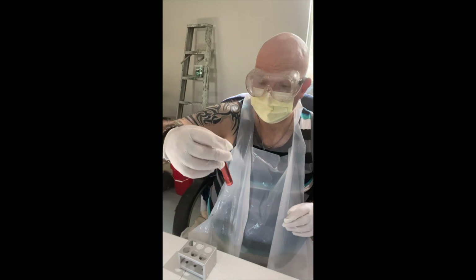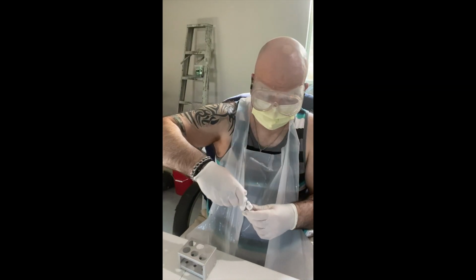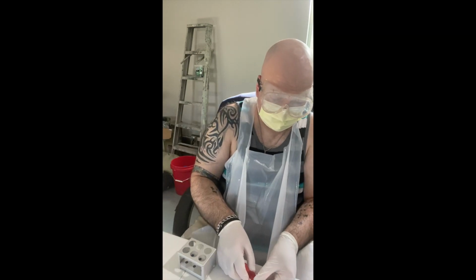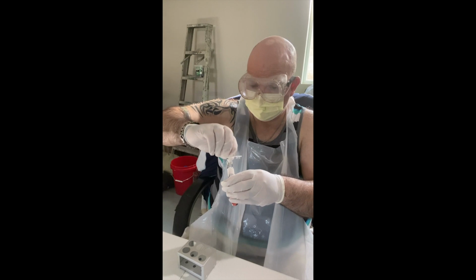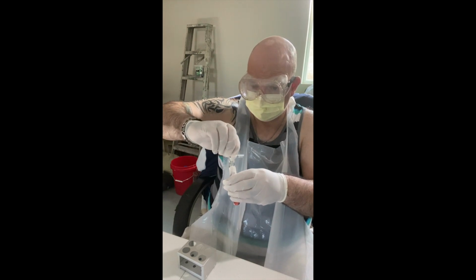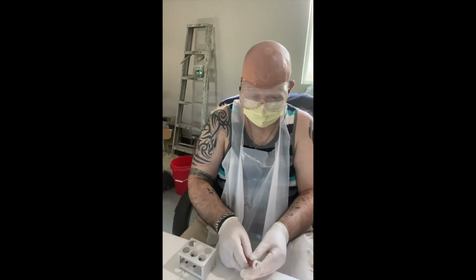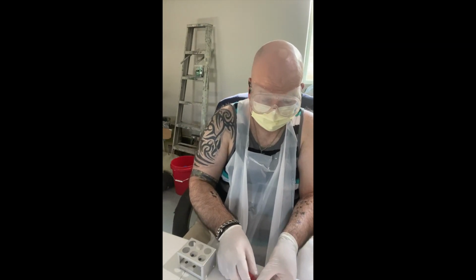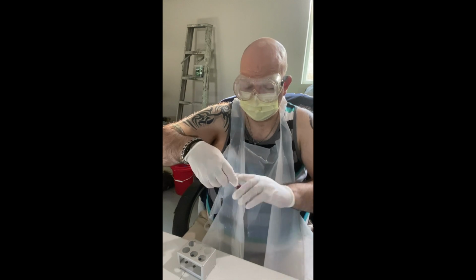And this is my epidermidis mannitol. Flaming to sterilize. Remainder of the powder goes in here. Okay. Garbage. Flame again. And then invert to mix.